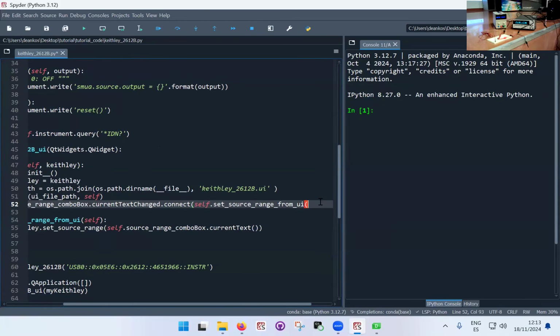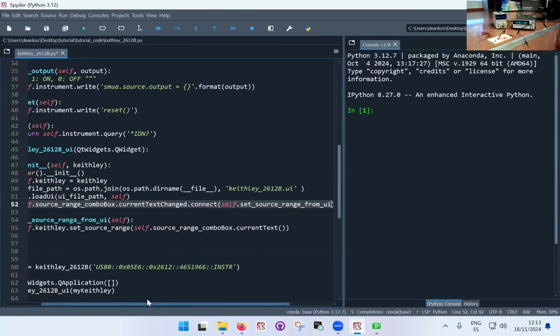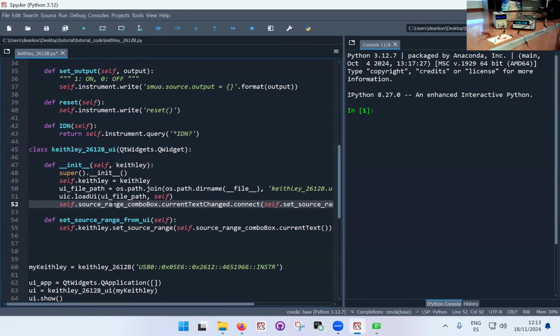This is a specific syntax thing. In this particular case, you connect it and you don't put the brackets as if you were executing. You just connect it to the name of the function. So what this does is that anytime I click the combo box and I select a new value, this is going to automatically execute this function here.